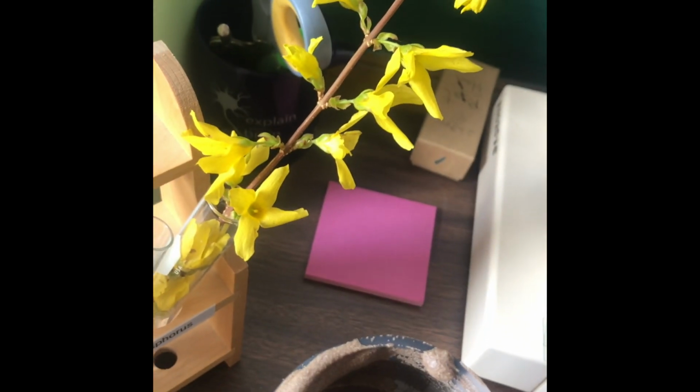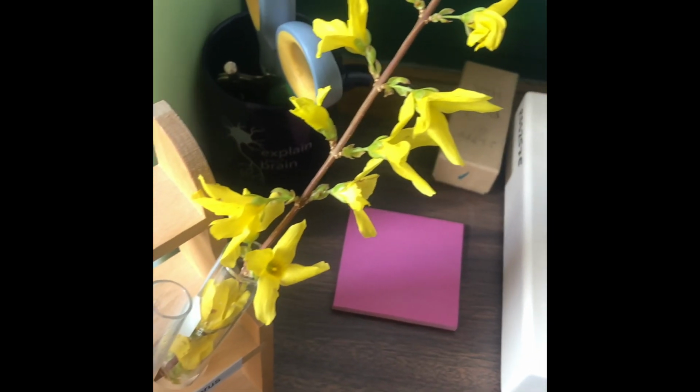This is a really pretty plant called Forsythia. We're gonna look at this under the microscope. I'll see what I can show you. All right, I wish you guys were with me so we could share in this excitement. Okay, here's what we just found. What in the world? Can you see it?